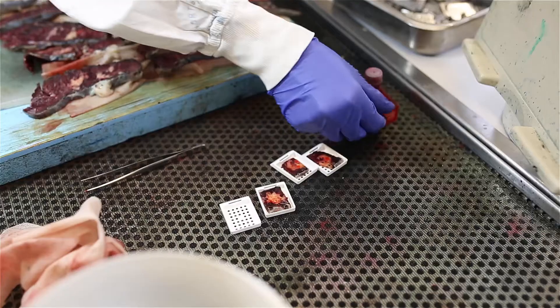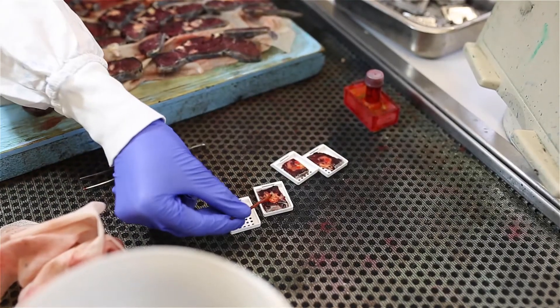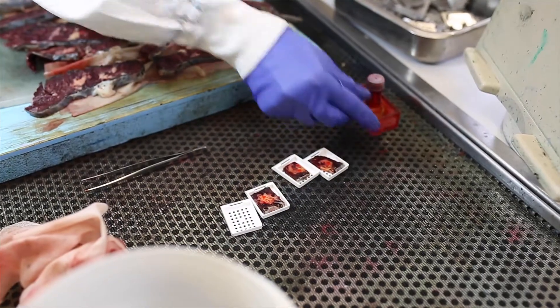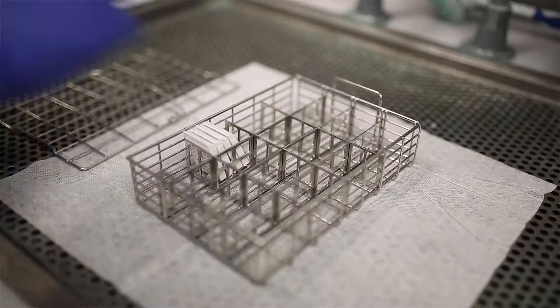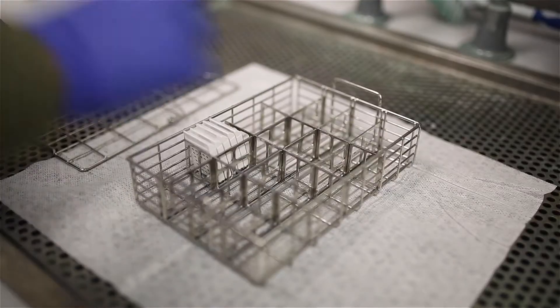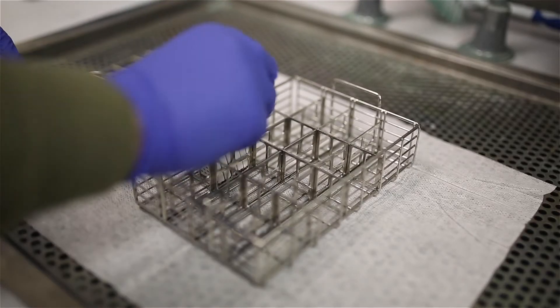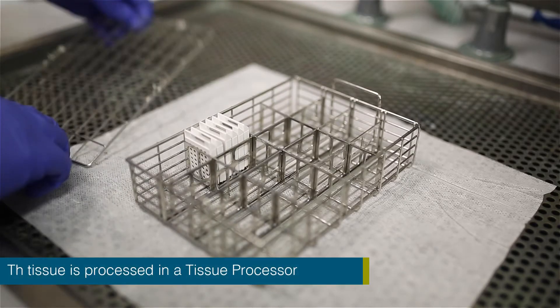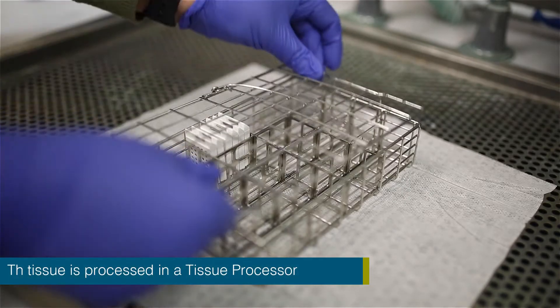After macroscopic examination and sampling of the specimen, the specimen is placed into tissue cassettes and the tissue cassettes are processed in a tissue processor.